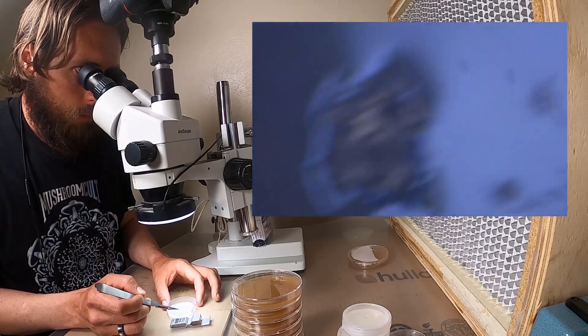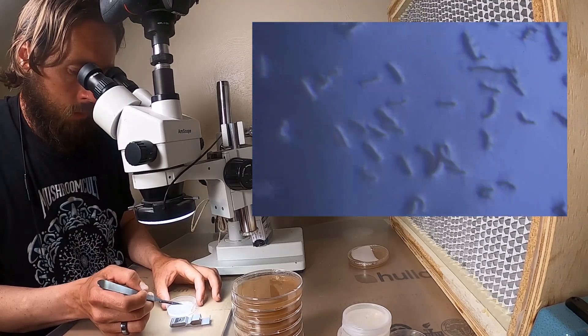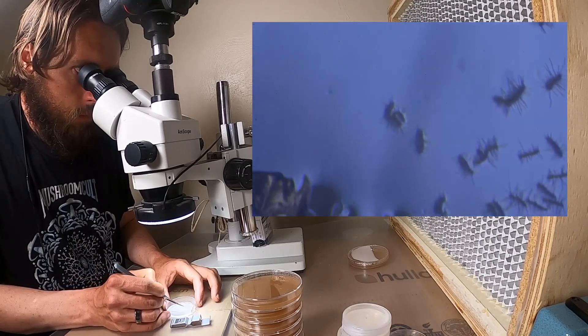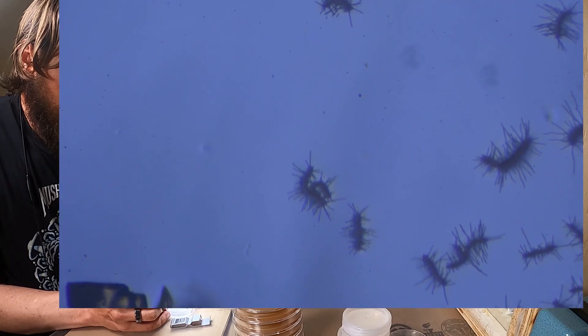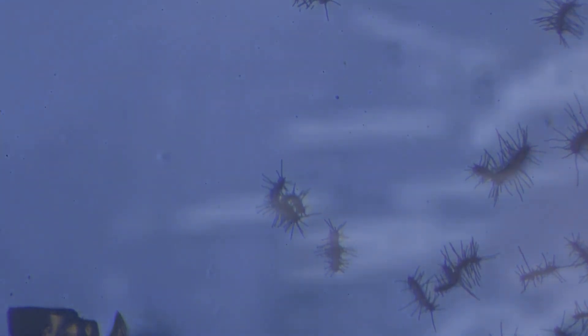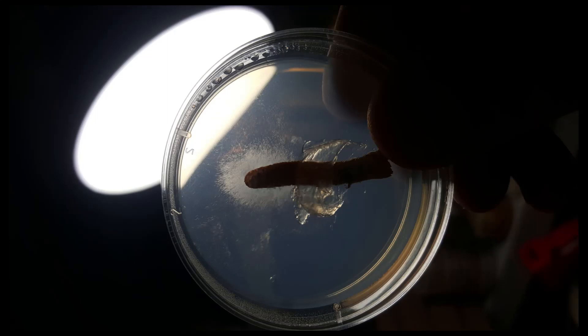So that's basically it. The tedious part is just looking around and finding the spore that is all by itself and then cutting it out. It's like finding a needle in a haystack. There we are back to the spore print.